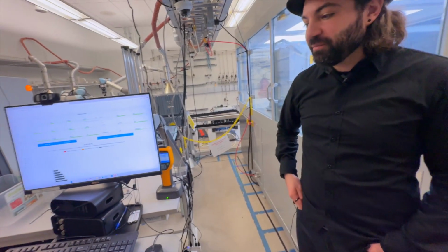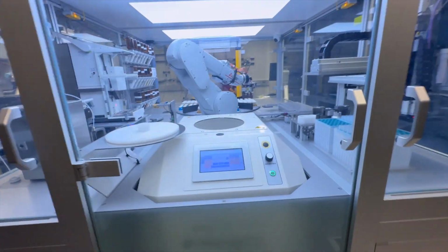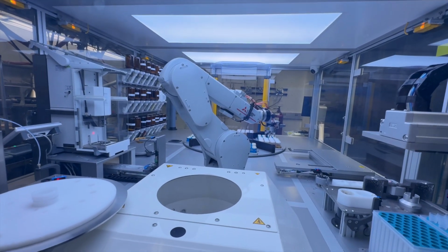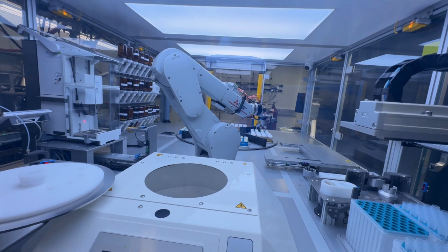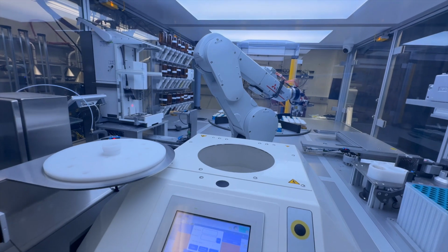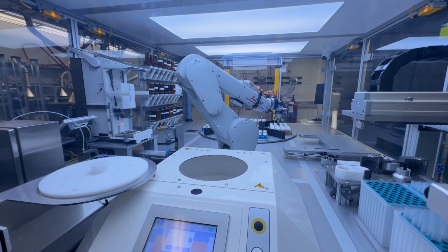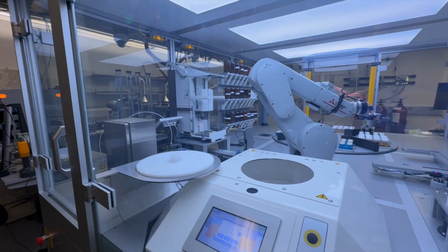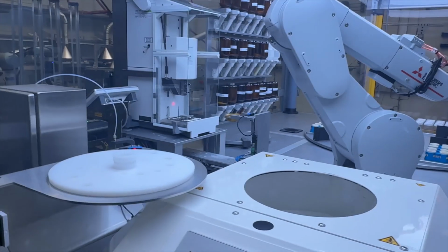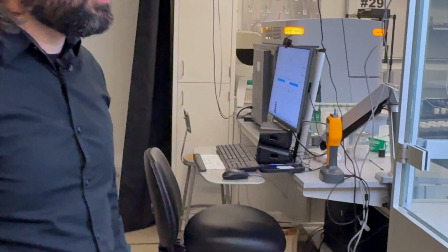So we start off with this machine, as you said, moving into this unit here. Yes. One of the things I noticed is there's a big old Mitsubishi logo on this robot arm. You mentioned that some of these pieces of equipment you've manufactured or made, others are purchased. I'm curious, how easy or difficult do these different vendors make it for you to put these robots together and orchestrate them through this robot software that you talked about?